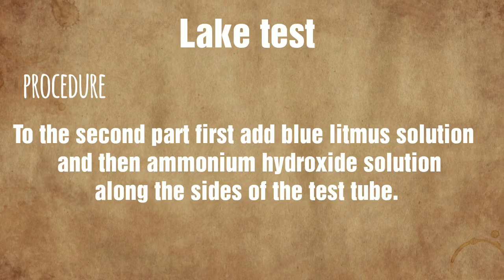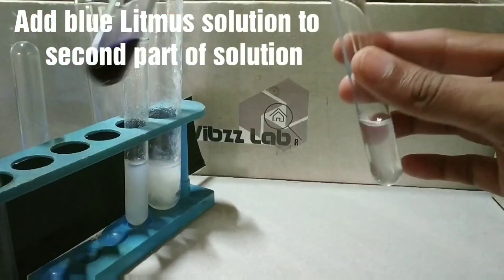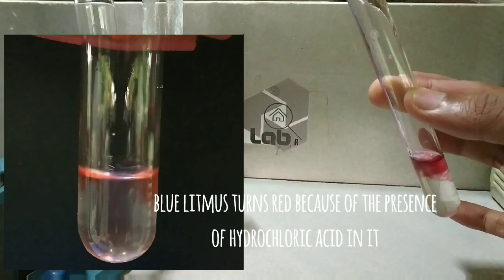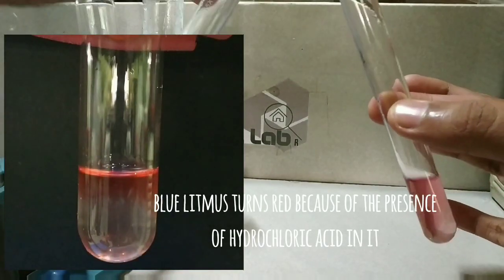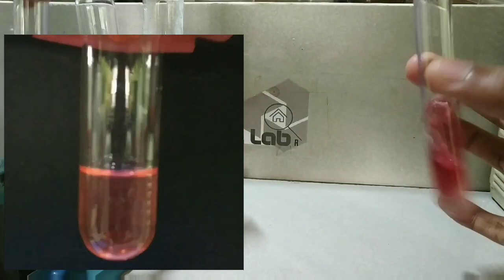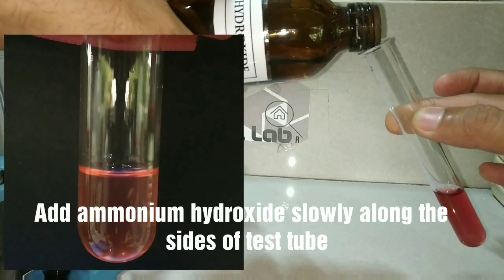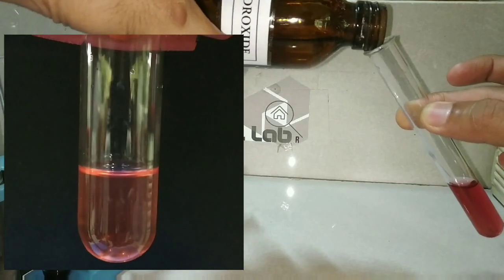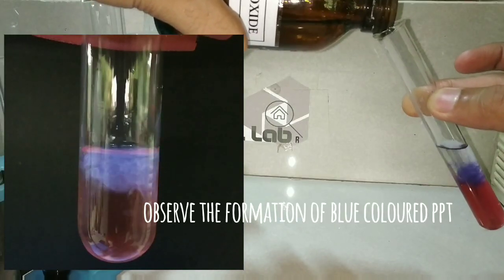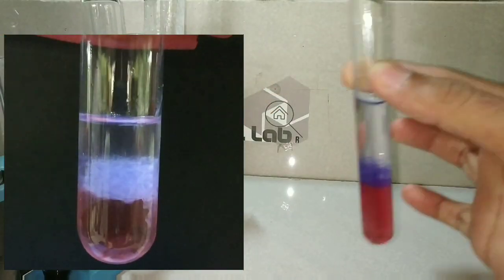There is a lake test where we add blue litmus solution into the second part of the solution and then we add ammonium hydroxide. I have taken the second part of the solution and here I am adding the blue litmus solution. You can observe that on adding the blue litmus solution it turned red because of the presence of hydrochloric acid in it. Now I am adding ammonium hydroxide slowly along the sides of the test tube. You can see that there is formation of a blue colored precipitate on contact with the solution and the red color is slowly getting discharged. And this blue precipitate is classically known as the lake.